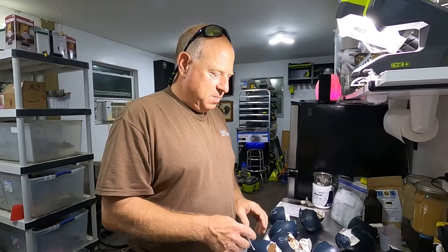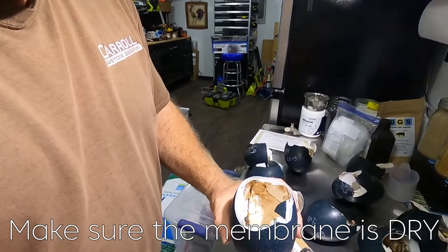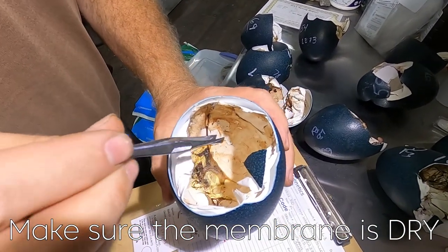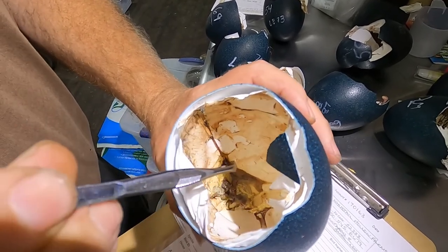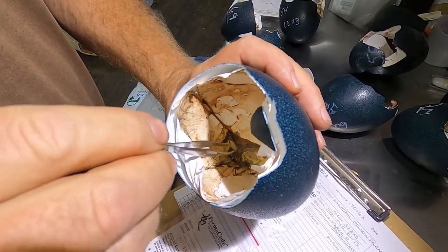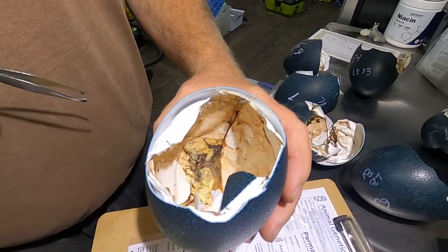Here's how you pull your sample. Everybody's kind of afraid of this, but find a good spot inside that's got some veins. If you see where I'm pointing down here, there are some veins. They don't need goo — they need veins. Anything that you can see veins in will work.